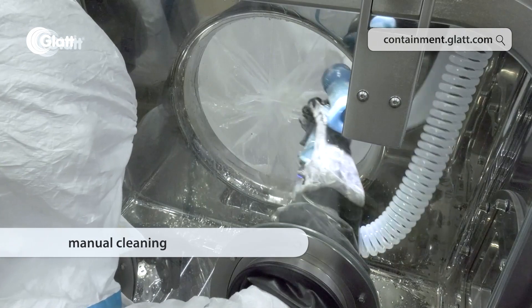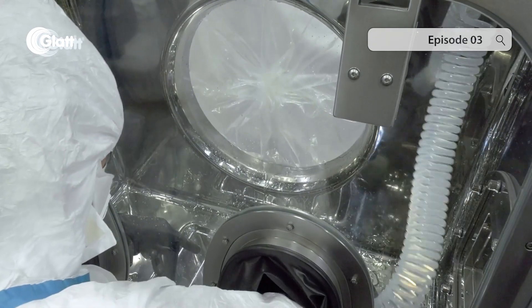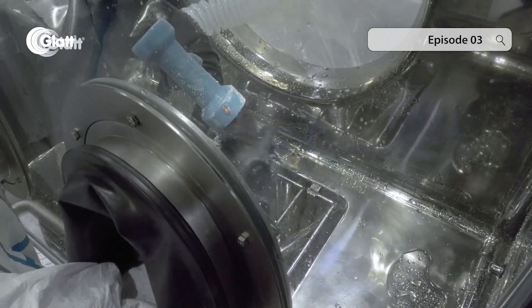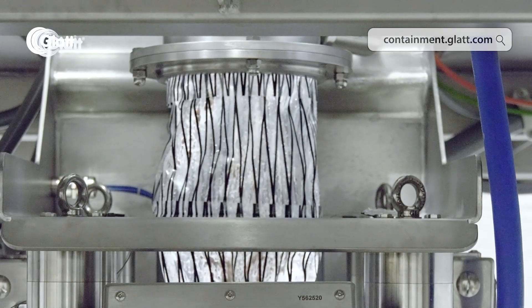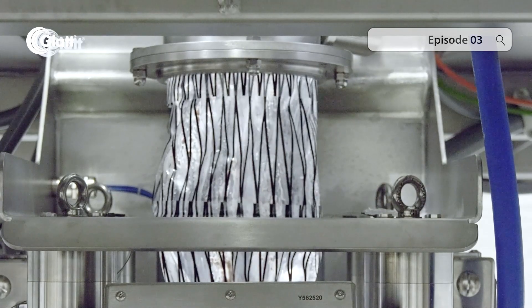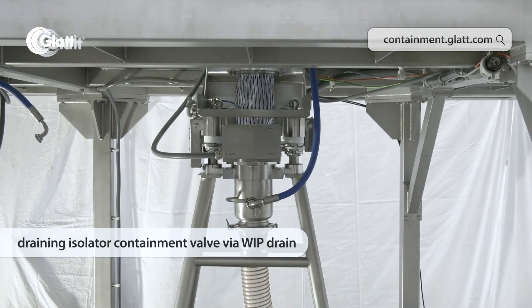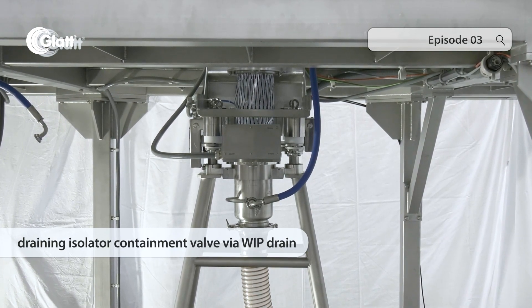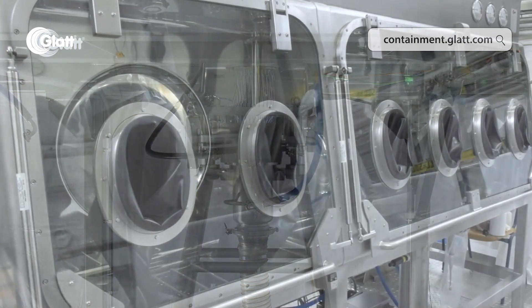Isolators are usually cleaned manually with cleaning nozzles operated with water or cleaning solution. The highly active dust in the isolator is bound and washed away. As the wastewater contains highly active product, it normally has to be disposed of specially. The drain on the isolator is coupled to the active valve on the discharge port using a split valve in the same way as the passive valve, so that emissions are controlled below 100 nanograms per meter cube.